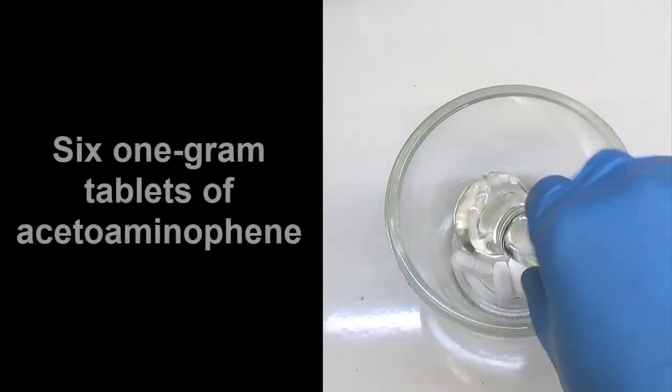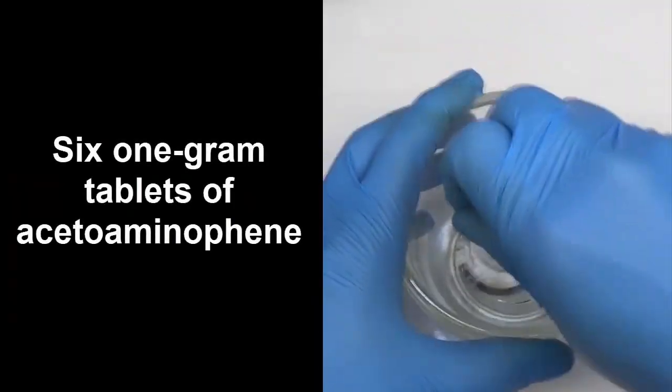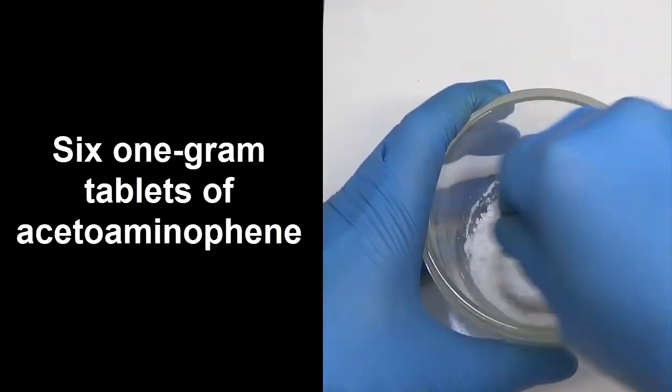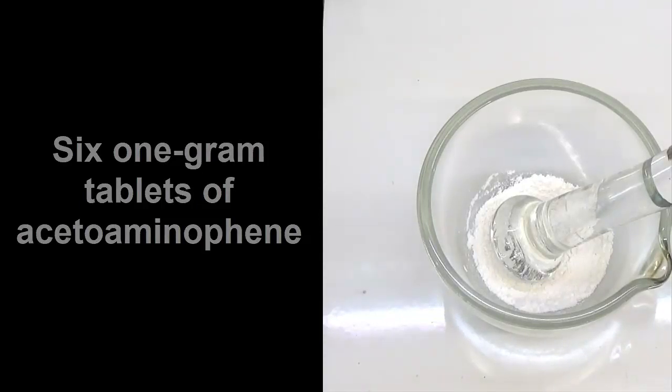The first step in the synthesis process is the extraction of acetaminophen from commercial tablets. Six 1 gram tablets of acetaminophen were crushed.